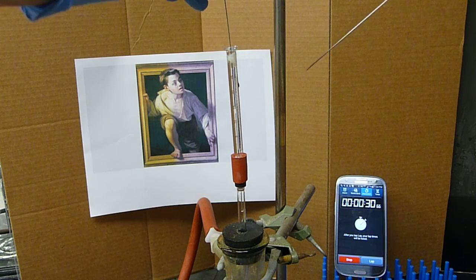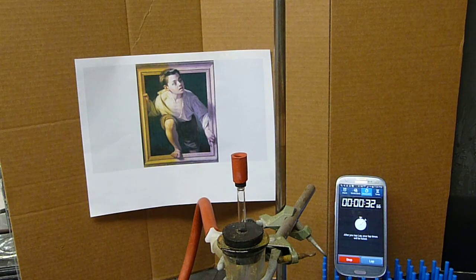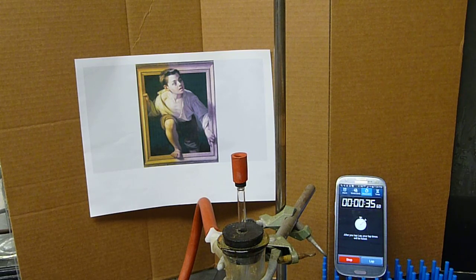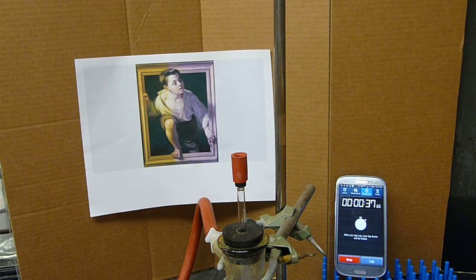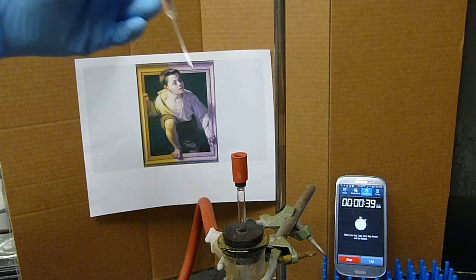All right. There's a 25 microliter syringe, one and a half ml of solvent, in this case acetonitrile. Wipe the blunt nose needle, another one.